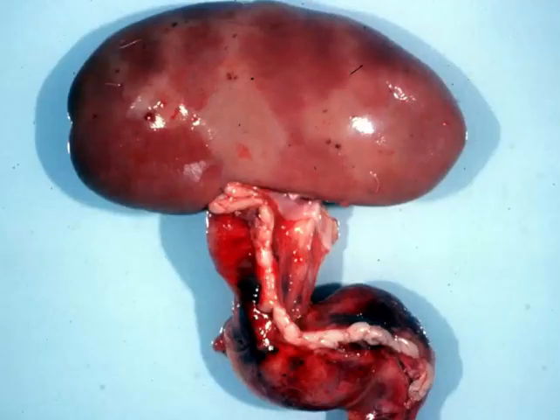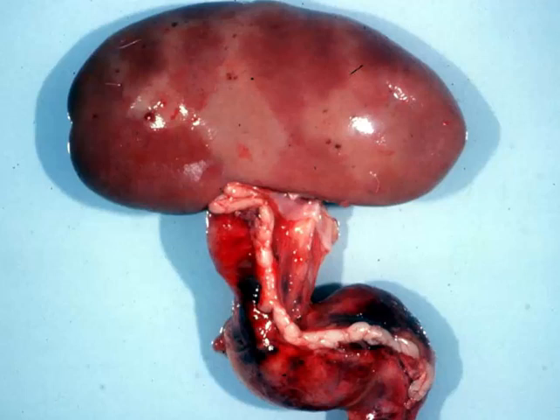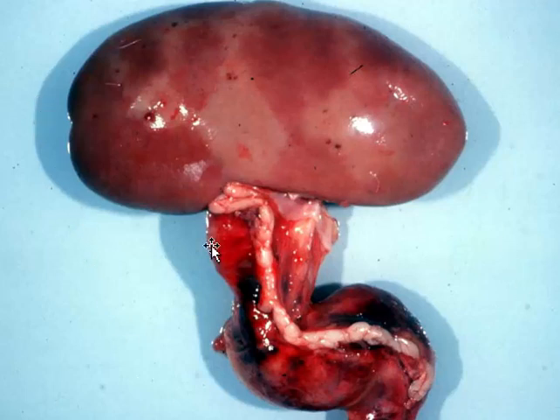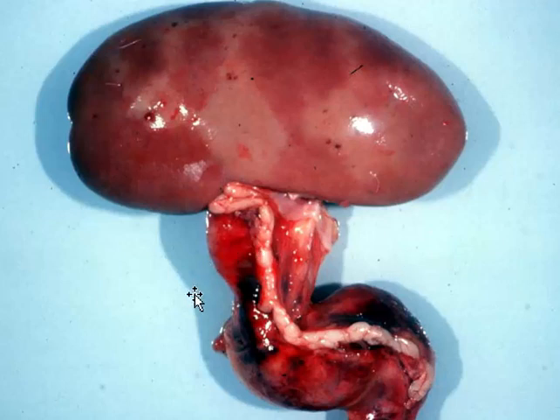Let's go with slide number five. We've got another pig here, and I would like a morphologic diagnosis and a cause. Okay, time's up. Most of the pathology is concentrated in the ureter. There are some changes up in the kidney as well — it looks a little soft, a little discolored, possibly some autolysis.